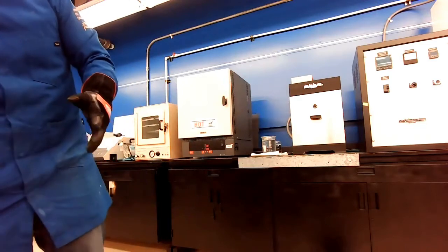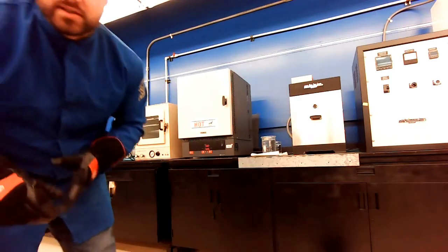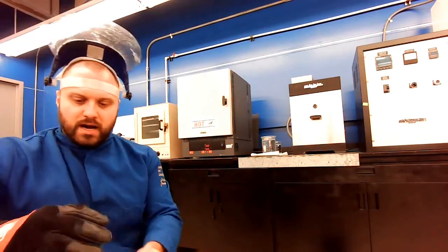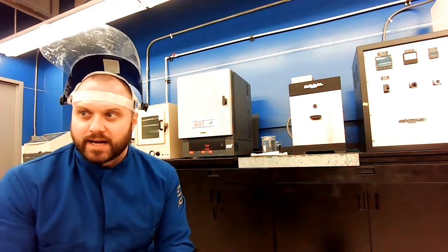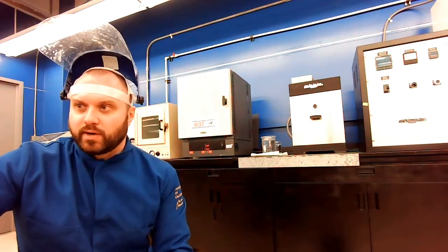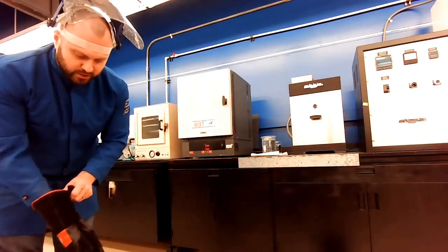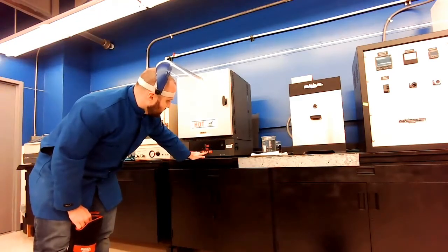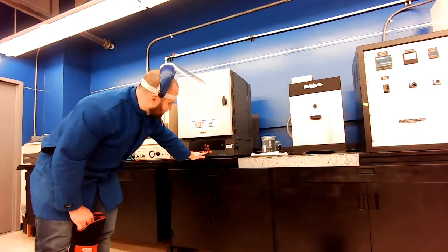Now, my third sample, remember I want that to be cooled down, but not in the same rapid manner. I want it to happen and sit at a temperature just below the eutectoid temperature. And we said that that would be 650 degrees C. So what I'm going to do is change the setting on this furnace to 650. So that's the new target.